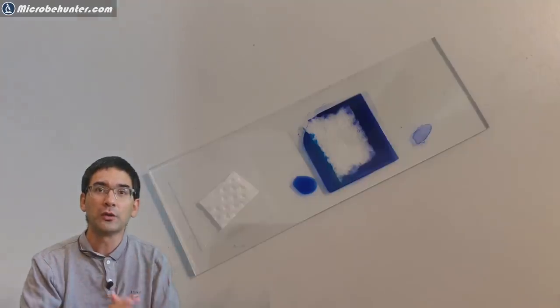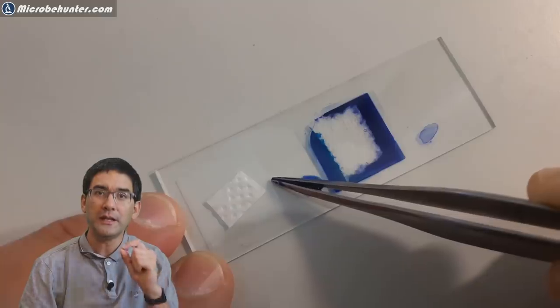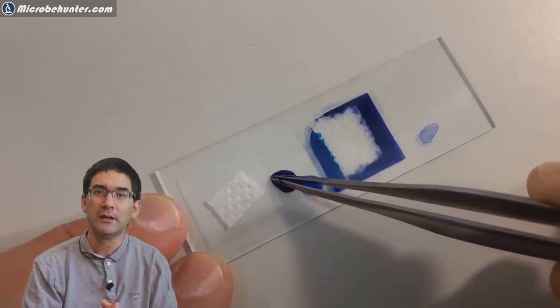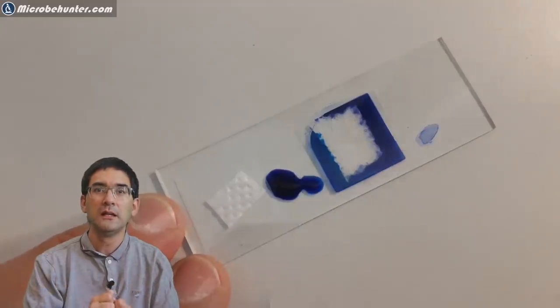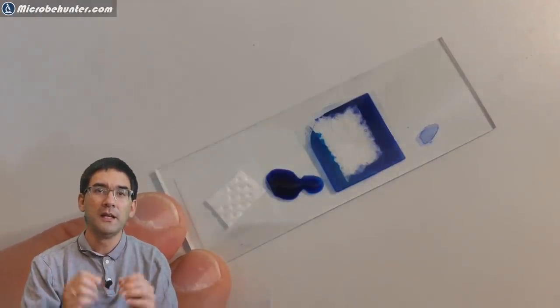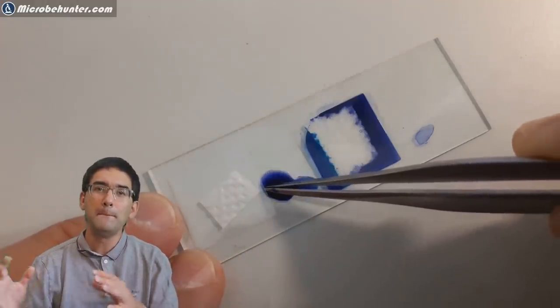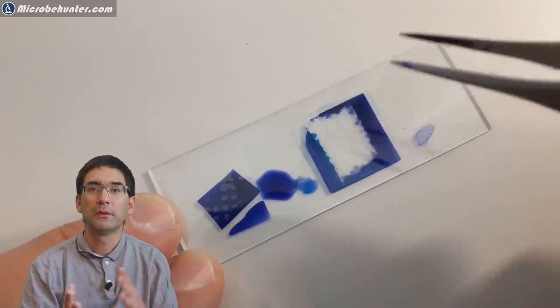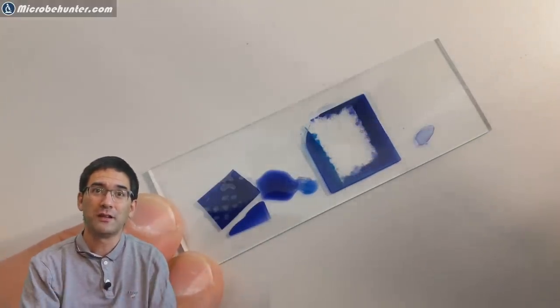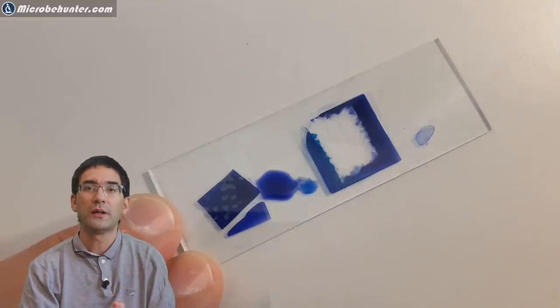Here's the control now. On the left side I put some regular tissue paper, and look how the ink and the tissue paper interact. On the right side is what I just did before, but now look at the tissue paper on the left. As soon as the ink touches the tissue paper, it's immediately sucked in quite quickly. Tissue paper with cellulose and cotton is the same thing, so you see the response to water is quite different.